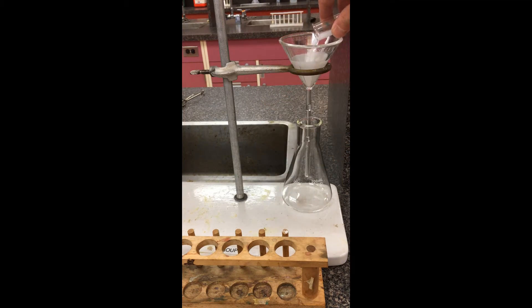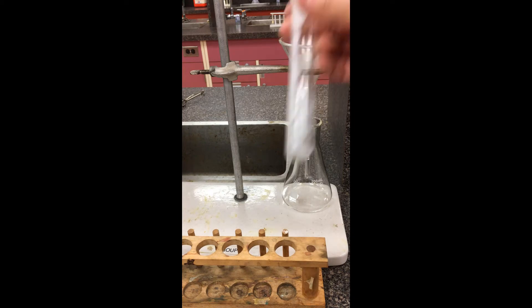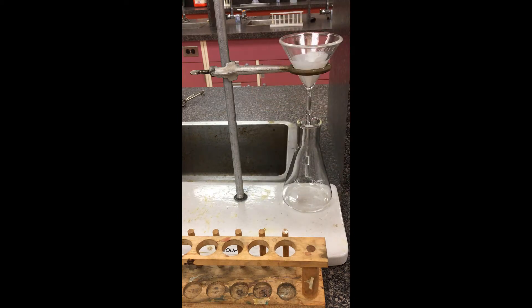Just going to dump it through this filter paper here. And again, I'm assuming that all the water would then go through the funnel there. We're going to call the liquid that gets through the filtrate. The solid that gets left behind because it's too large to actually get through the pores, we're going to call that the residue.